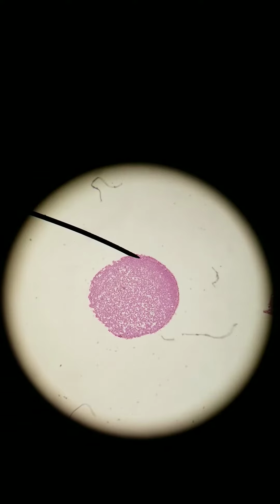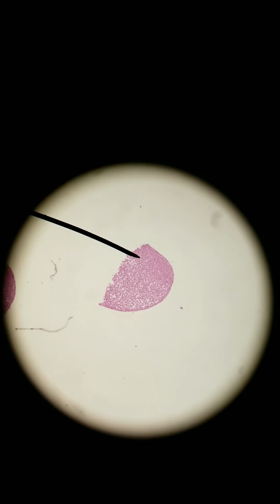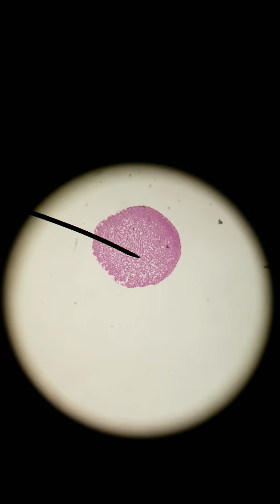Hi everyone. Right now we're looking at a fish embryo. So this whole circular structure you see is a fish embryo made of a bunch of different cells. Fish embryos are in constant development, so a lot of them are undergoing mitosis. When you look at a fish mitosis slide, you'll see that there's this one here, but if I move to the side, there's another one, and there should be another one over there, and another one over here. So we have a bunch to choose from.